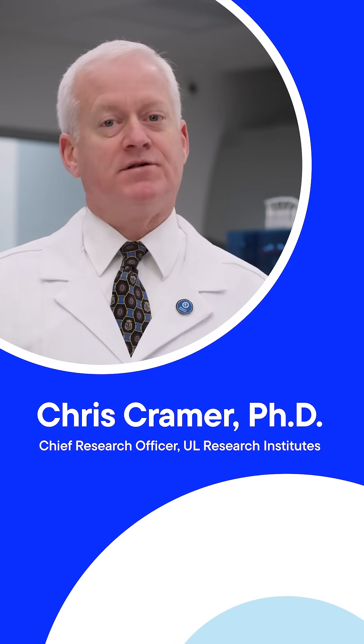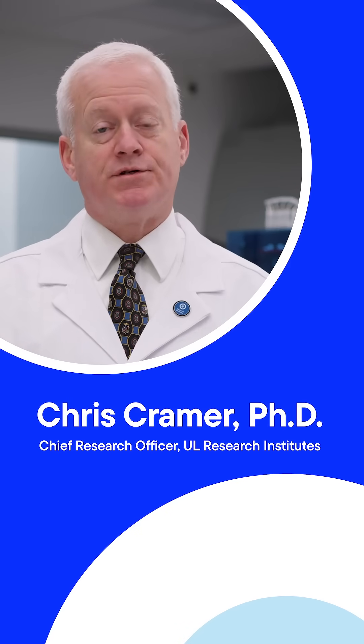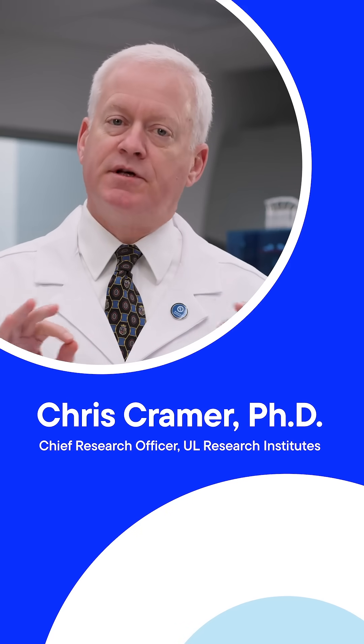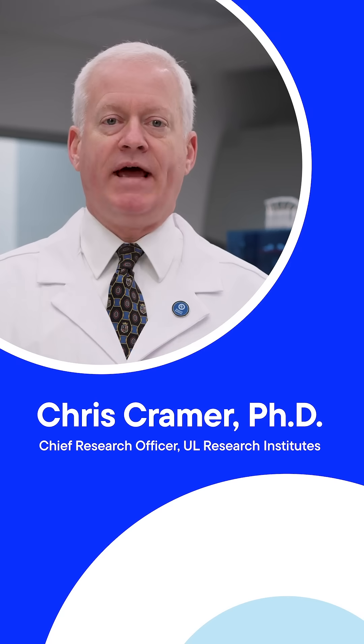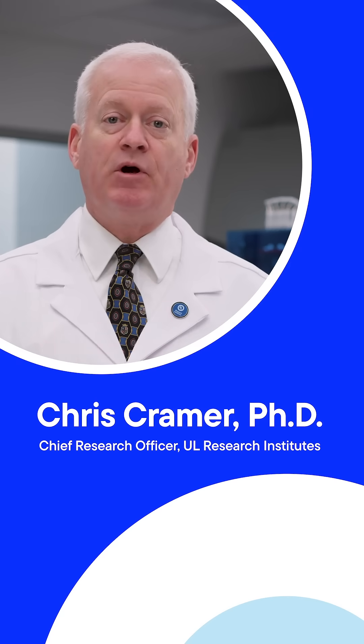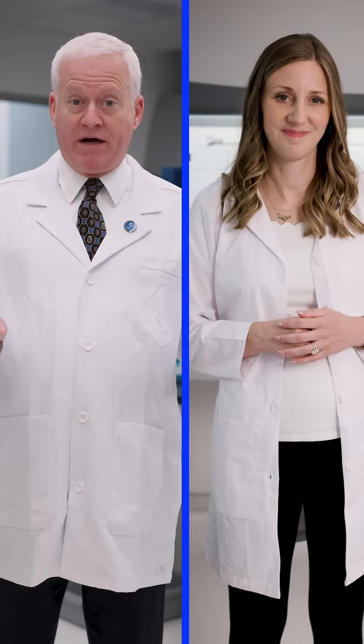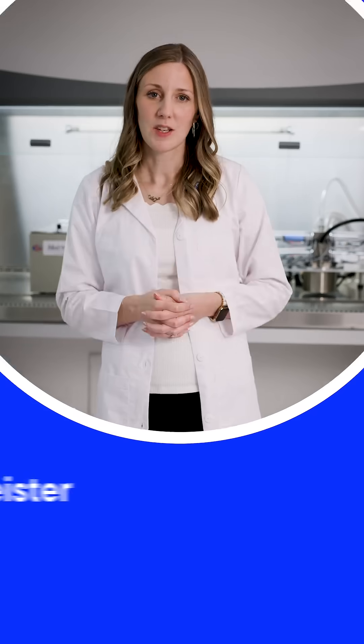One of the amazing things our toxicologists do is isolate cells to learn exactly how they react to certain chemicals inside the body. I'm with Dr. Maureen Meister. This is one of her research specialties. Maureen, tell us what we're looking at here.